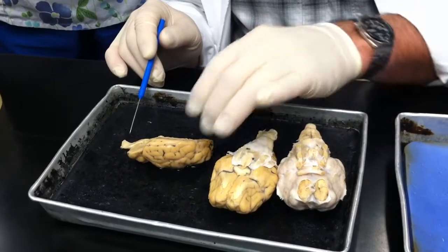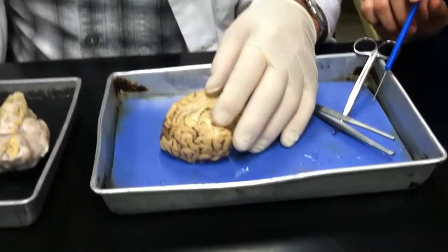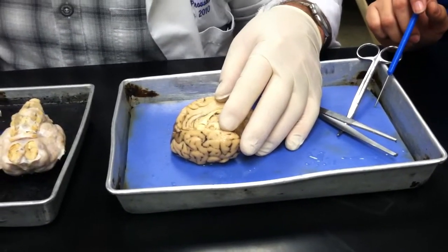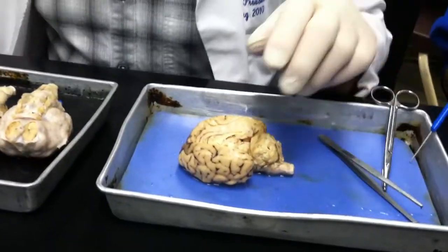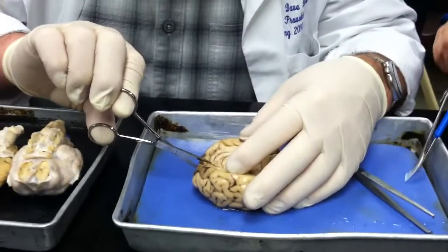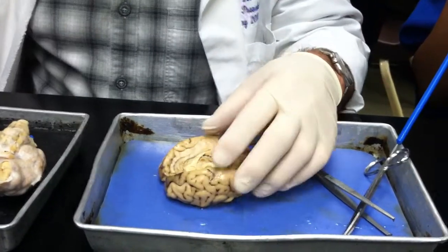Let's see, what else do we have on this one? Let me look at this one. Does anybody have a scalpel? Or a knife? No, like a knife. Okay, well, a pair of scissors will have to do. Oh, here, you got a pair. Well, those are funky. Here, I just wanted to cut this thing in half so we could see a little bit more detail. Okay, that'll work.